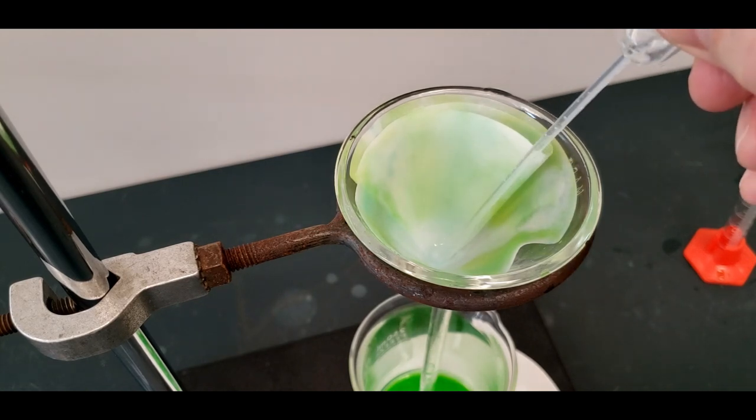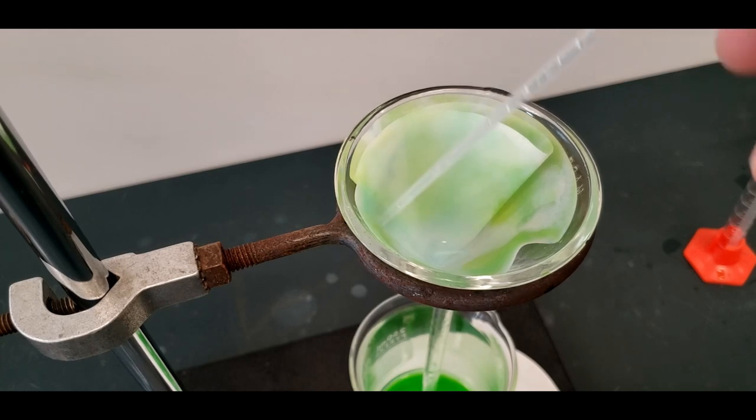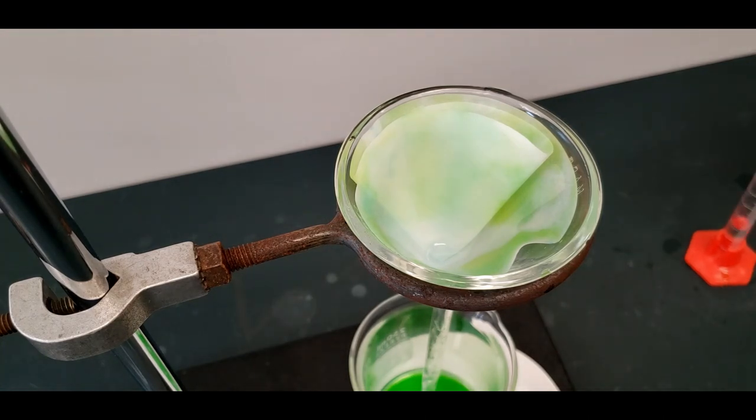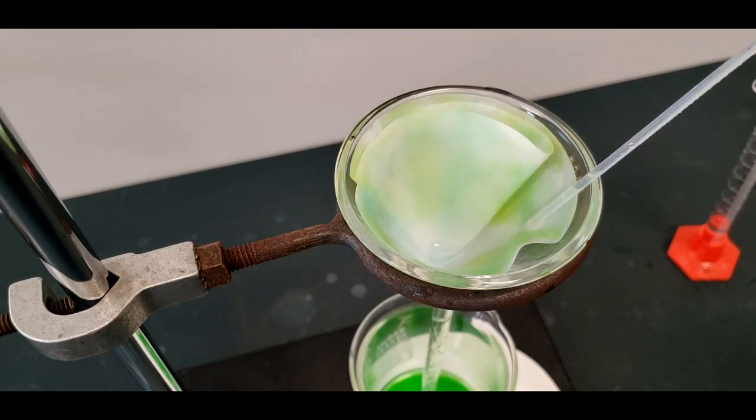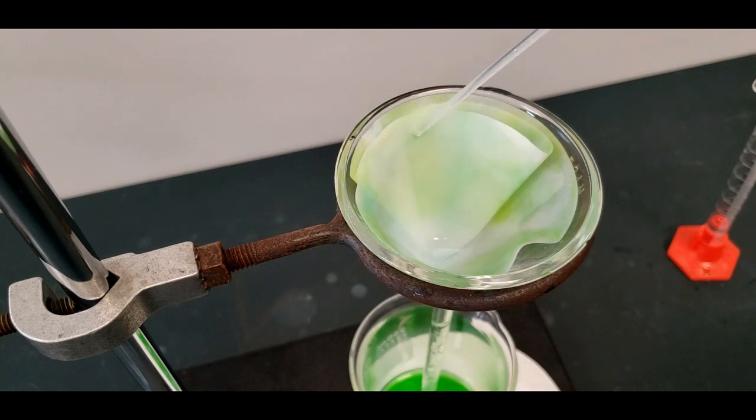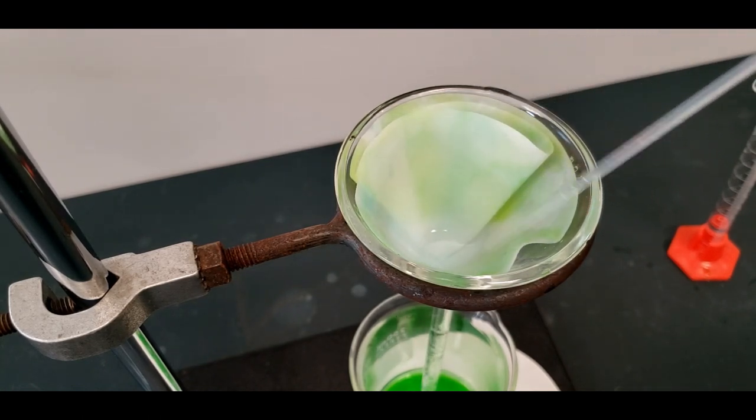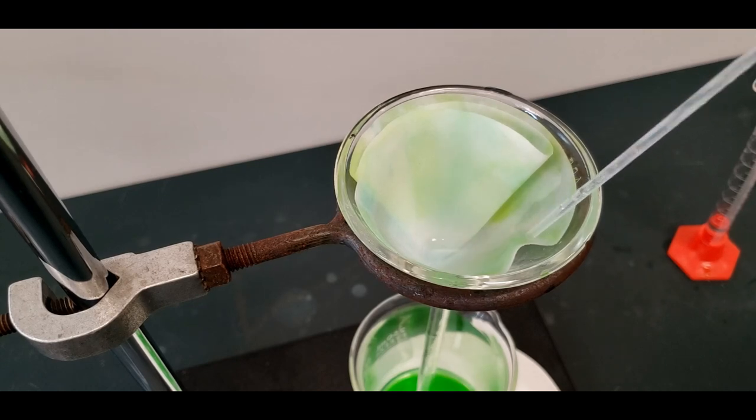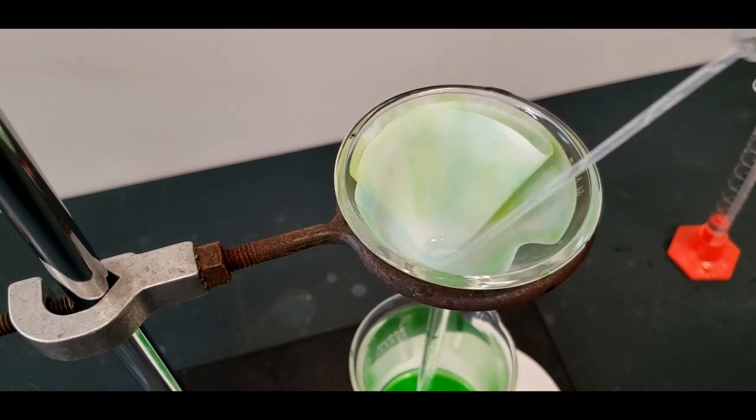I notice some is collecting at the bottom here. So might as well drag that back up. I got the water in a graduated cylinder and the pipette doesn't reach. I think you get the idea. You can see, I just wanted to show you that it's definitely possible to get all of the green off of here. Just have to be patient. Take your time with this.